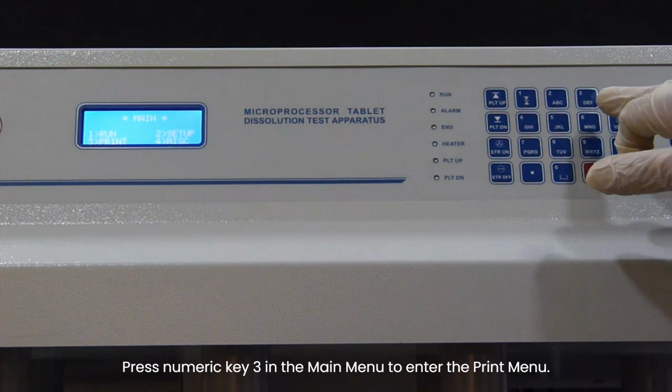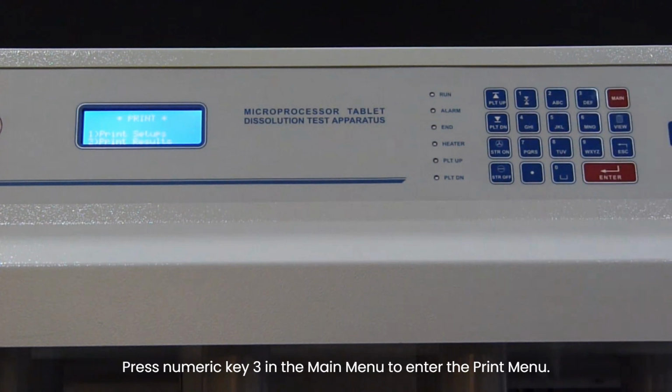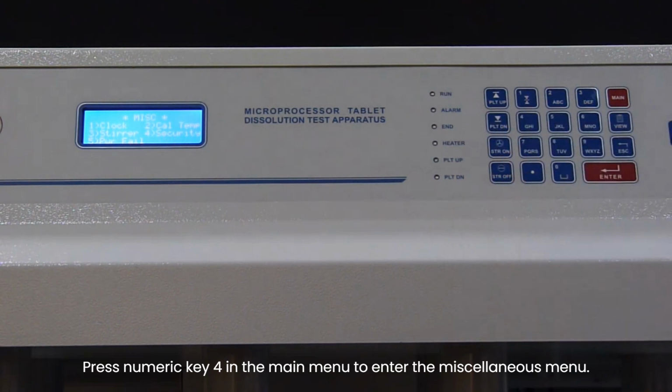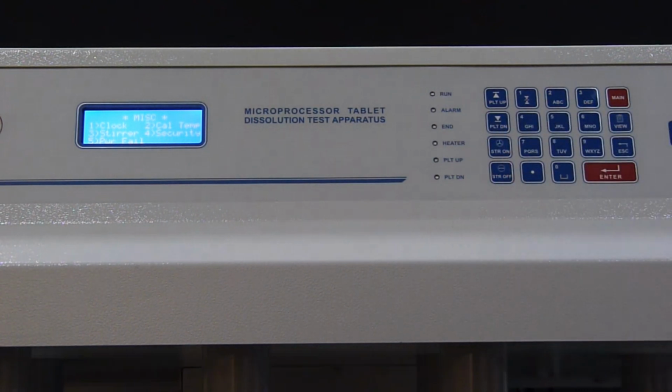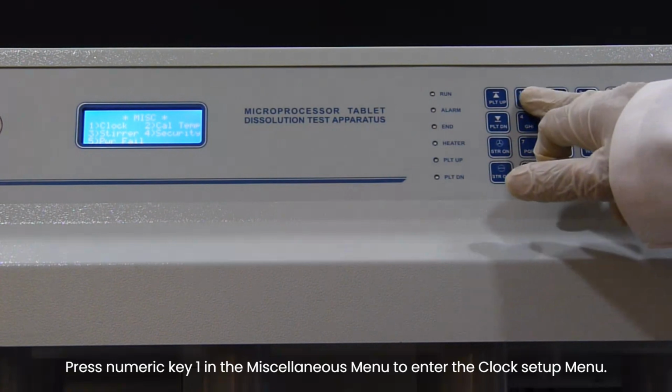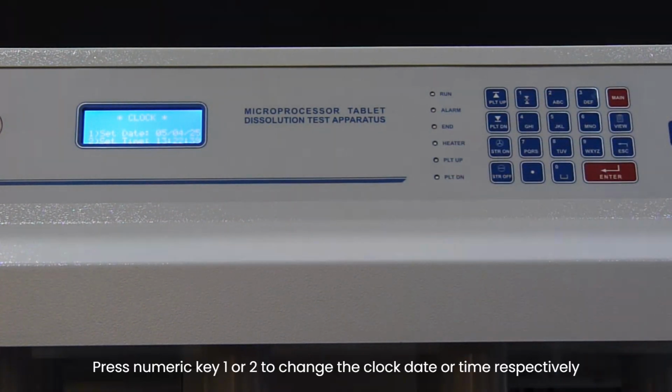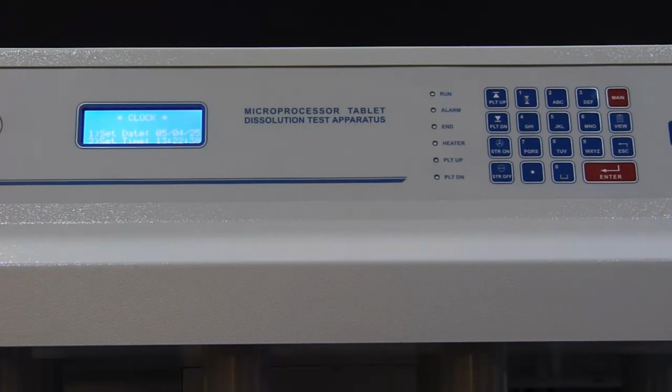Press numeric key 3 in the main menu to enter the print menu. Press numeric key 4 in the main menu to enter the miscellaneous menu. Press numeric key 1 in the Miscellaneous menu to enter the clock setup menu. Press numeric key 1 or 2 to change the clock date or time respectively.